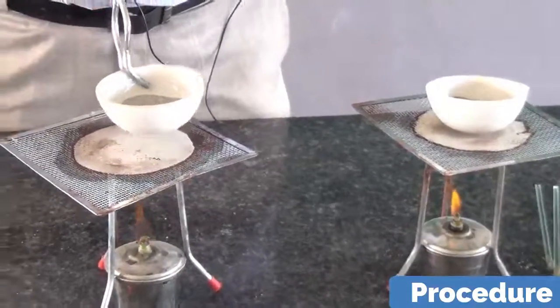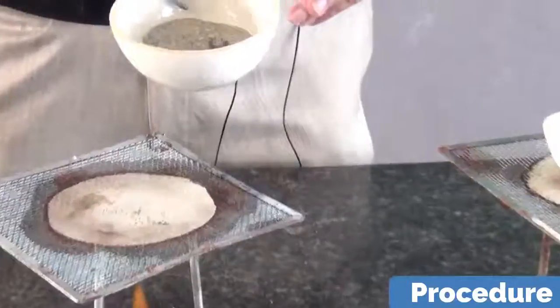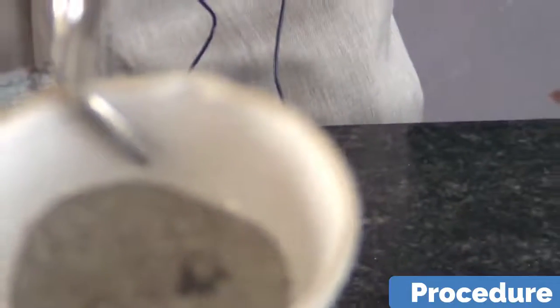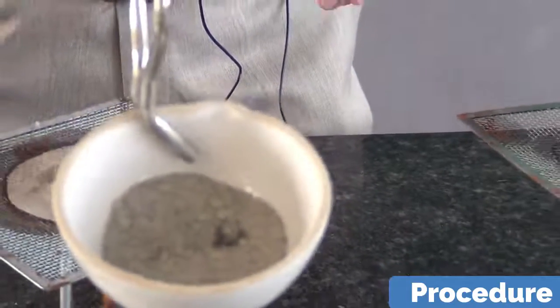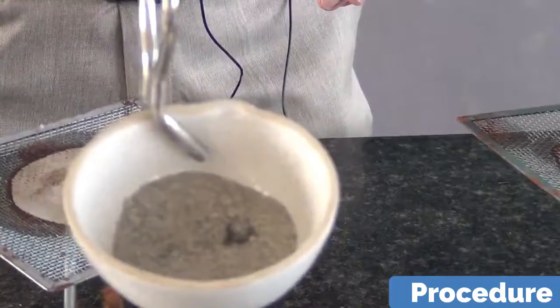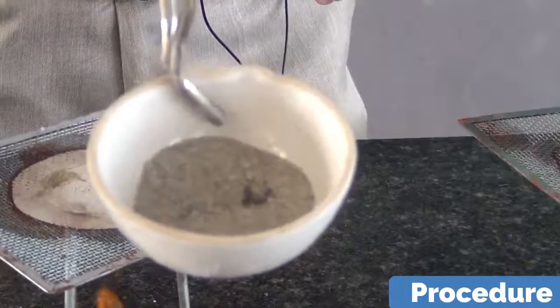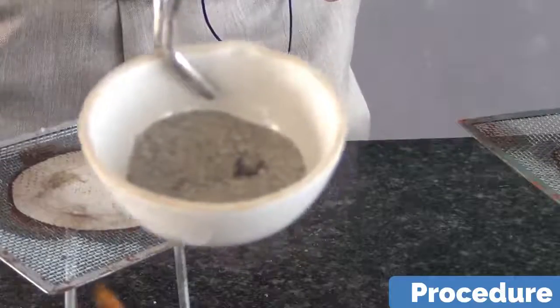Now you see, 10 minutes has passed and you can see the color of sandy soil after 10 minutes. This is the color. After heating it and the water is not left here now, no water is left.